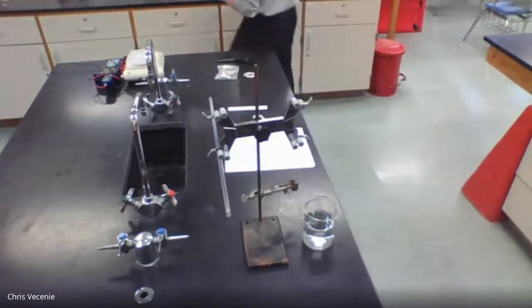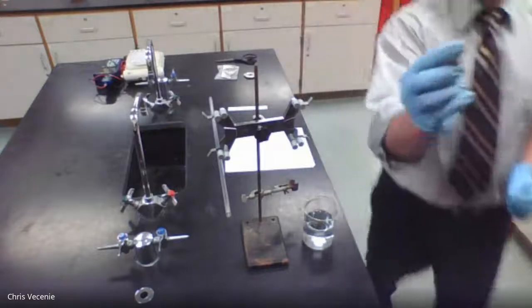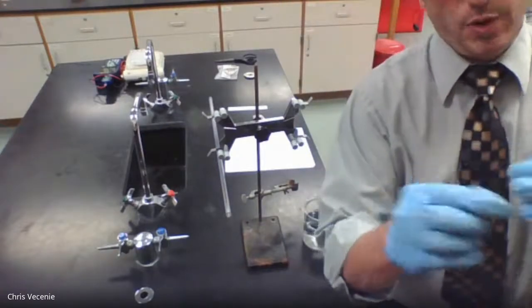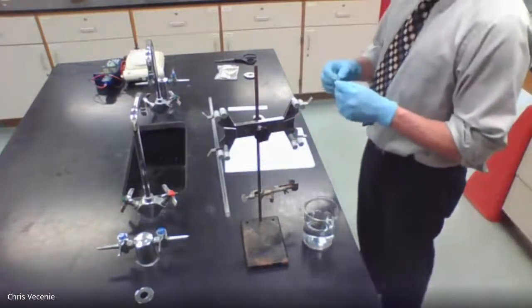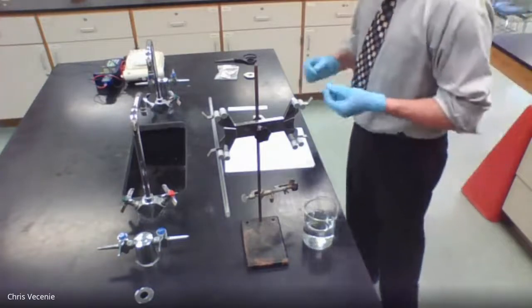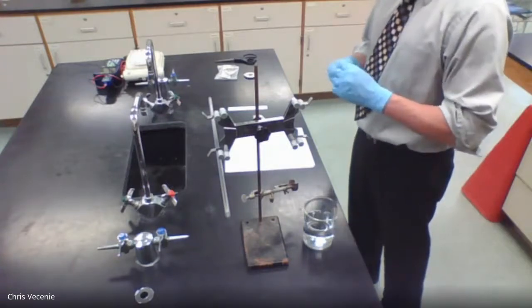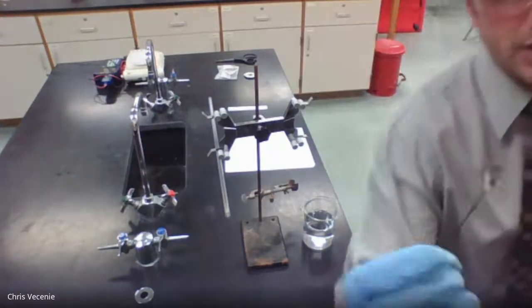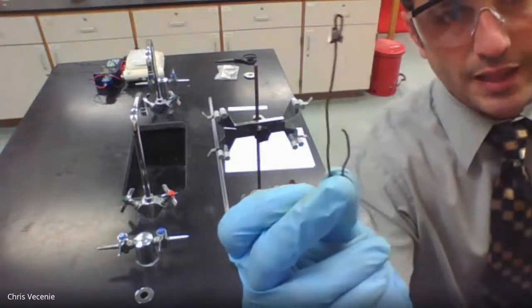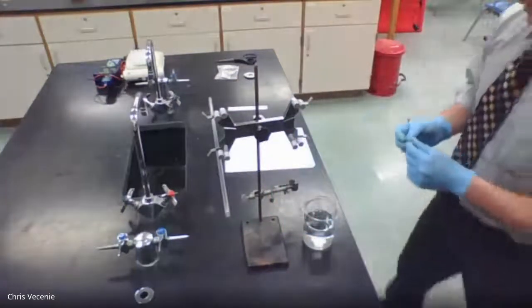Then I'm going to come over to the middle counter. I'm going to grab a piece of wire and a cork. So I'm going to get my copper wire, which is what I'm going to tie my magnesium ribbon to, and a cork for the bottom of my gas collection tube. And then it tells me to get a piece of copper wire, 15 centimeters, and twist and fold the magnesium around it so that it can't fall off, which means we want it to look like this. You can see the magnesium on top of the wire, so that the acid will fall on it and be able to react.